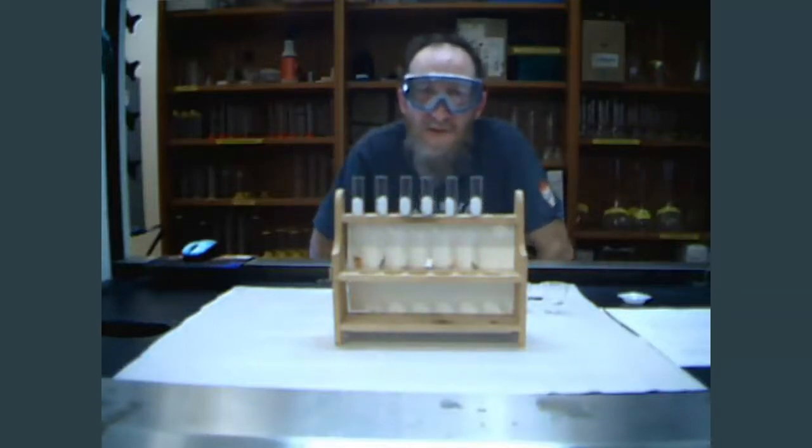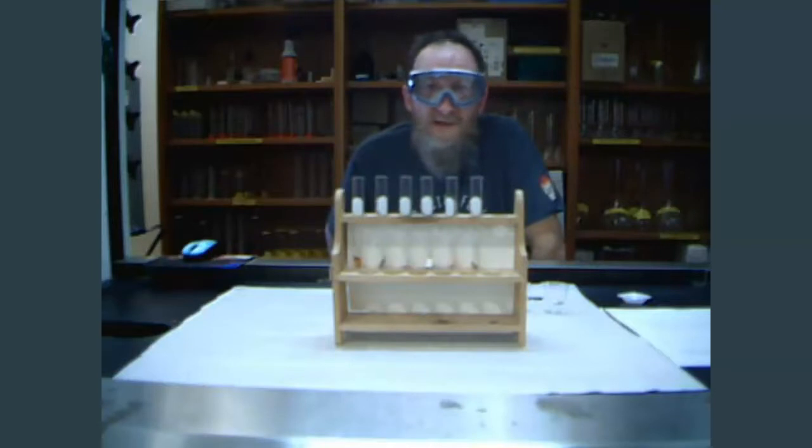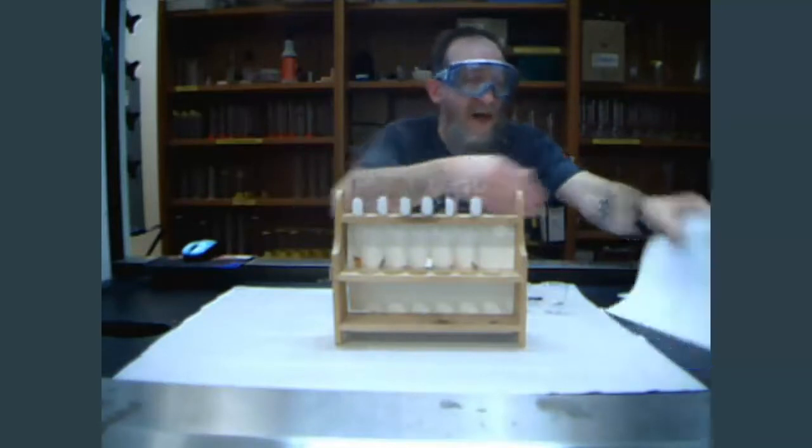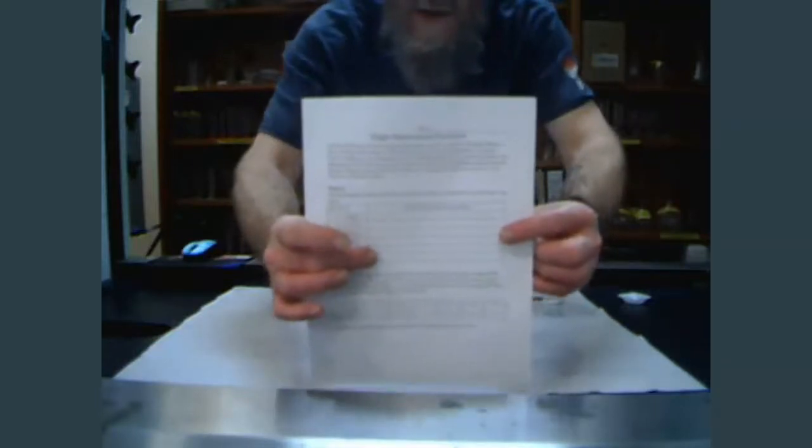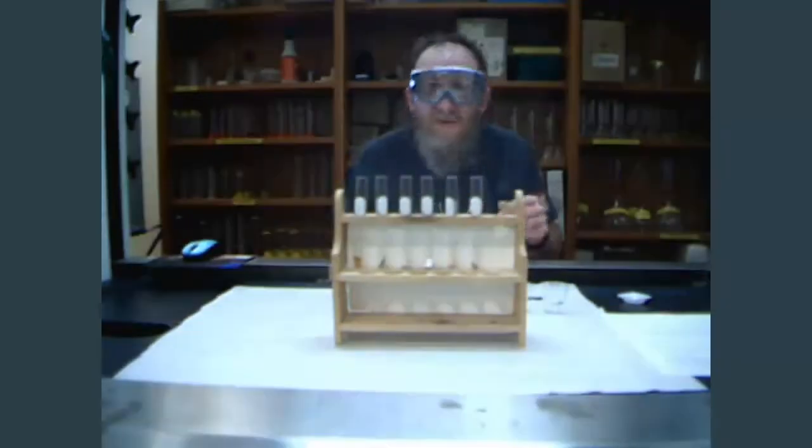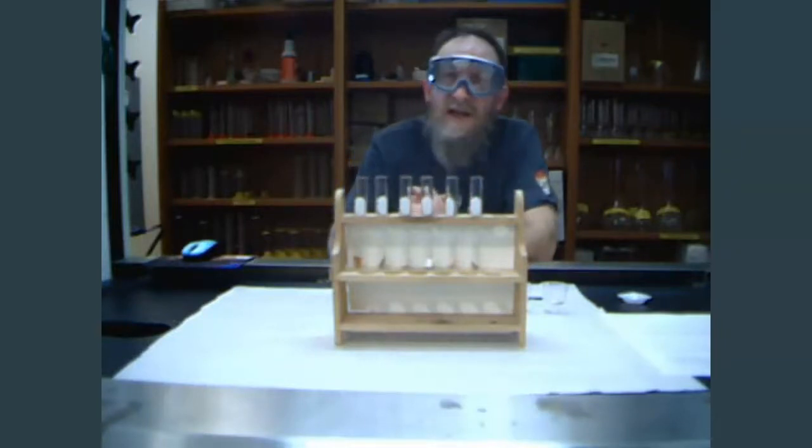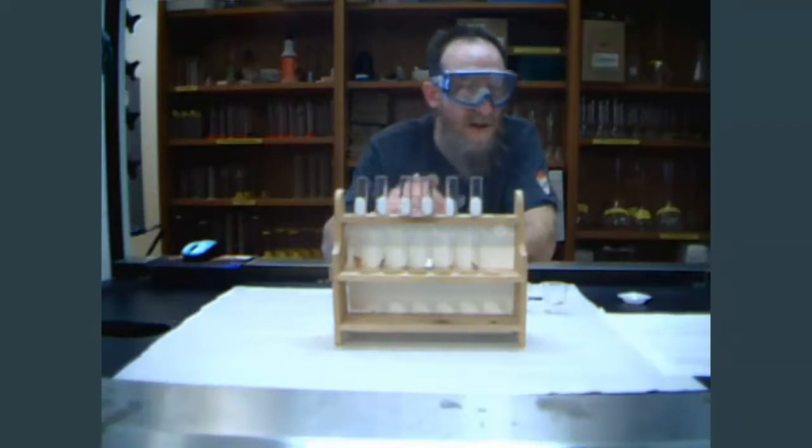Once I actually add all the solutions, we'll look for any evidence of a chemical reaction. And then I'll fast forward through, through the magic of editing, so we don't have to wait the entire ten minutes. And then we'll try to figure out which one is more reactive. And then we can pull out our chart, so we're going to have our evidence of chemical reactions.